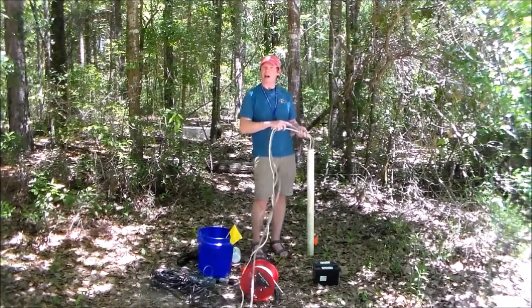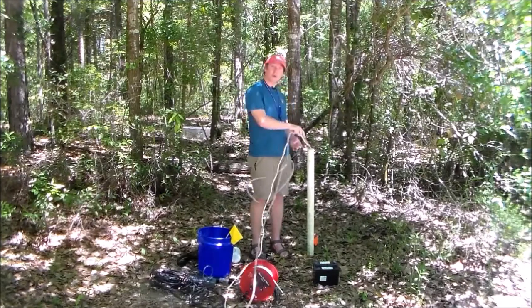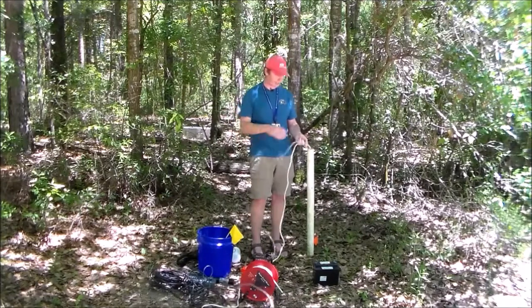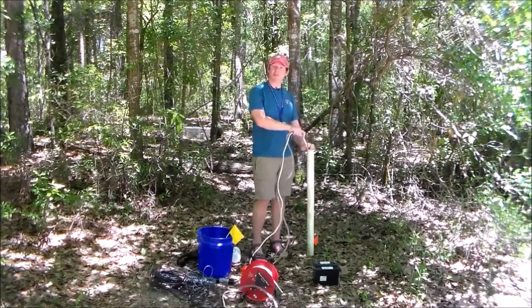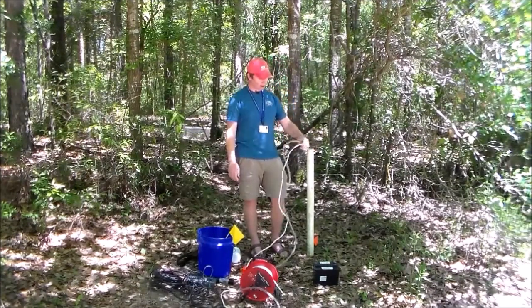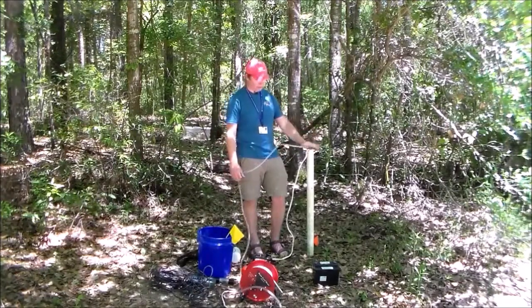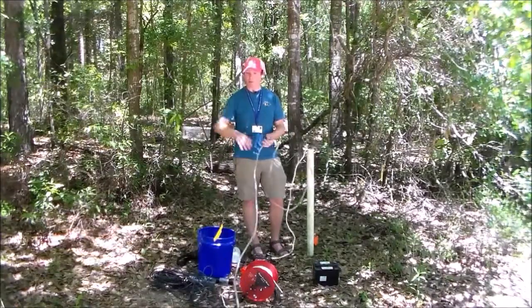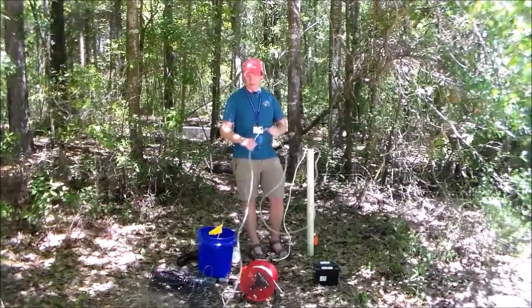But there's a limit to how high you can suck water before eventually the vacuum becomes so great that instead of pulling the water upwards, you actually start to boil it, which is something we want to avoid. Now, theoretically, that takes place at about 10 meters, so you can pull water up 10 meters over its surface, but in practice, it's going to be quite a bit less. And so we're not going to deal with that. We have to go down quite a bit. We've got to go down 8.4 feet to get to the water table, and when we start pumping, we're going to get a cone of depression, so this is the best way to do it.